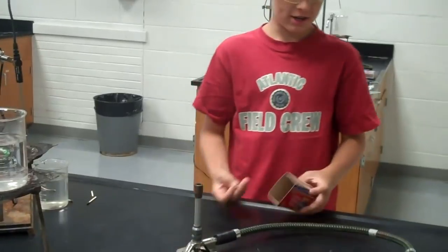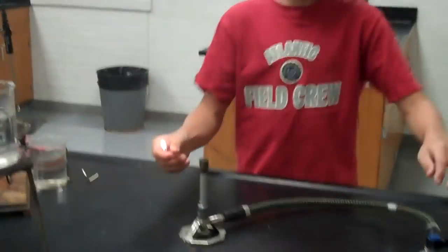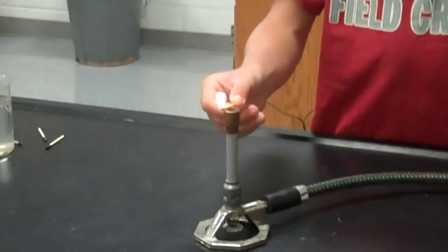Take a match and strike the match. Move the box away. Get it close to the Bunsen burner. Turn the Bunsen burner on.